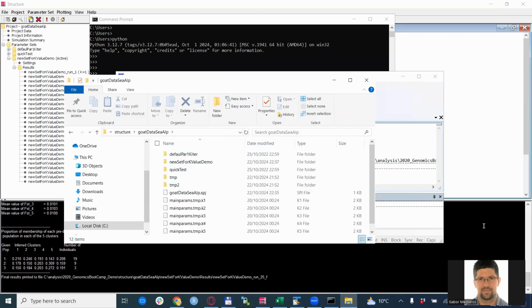So there is the project directory within the structure that you have created. So this is the data name. So this is the project name. You see here in the structure up project is this goatDataSeaAlp, so the Southeast African Alpine. And there are also folders for each run or for each parameter set. Now we use this new set for k-value demo.